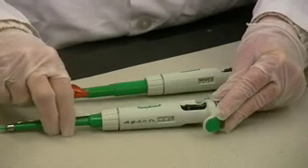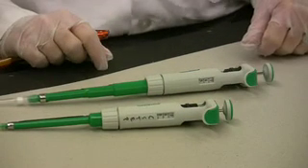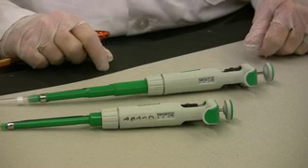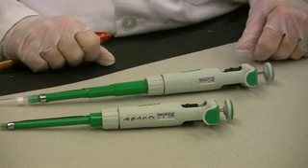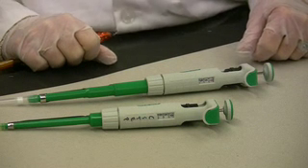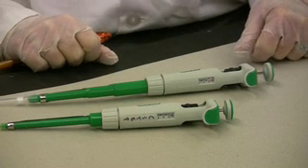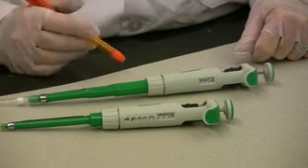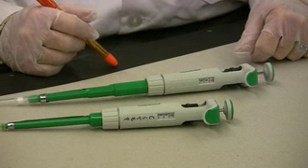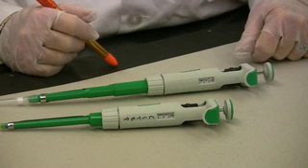Because one should never exceed the limits of the pipetter, one generally has multiple pipetters available, with volumetric ranges that range from 0.5 microliters to 1,000 microliters.